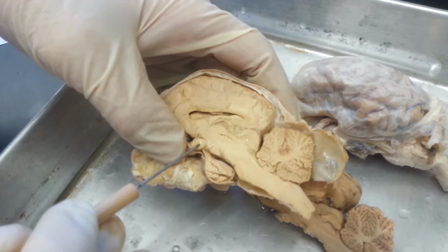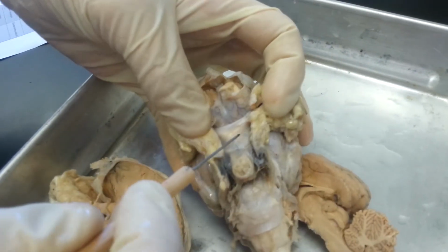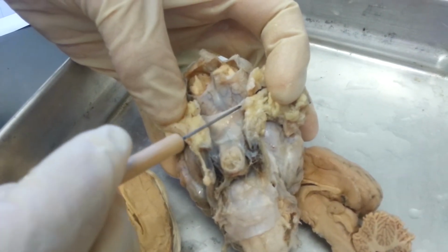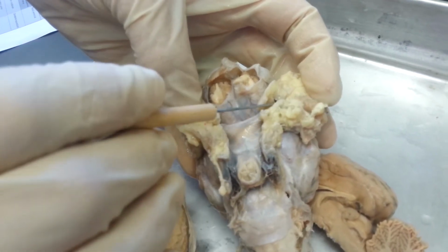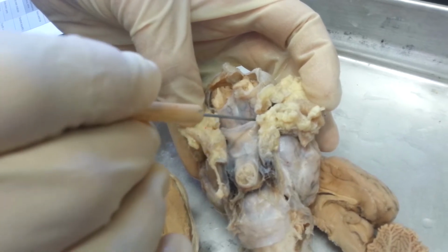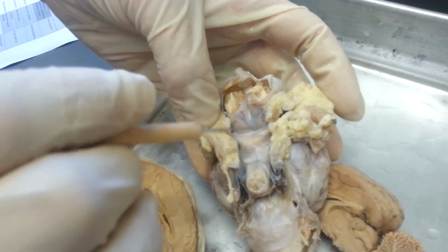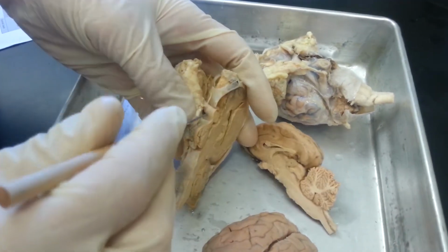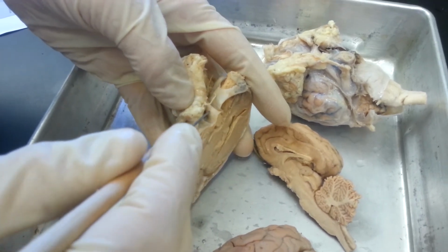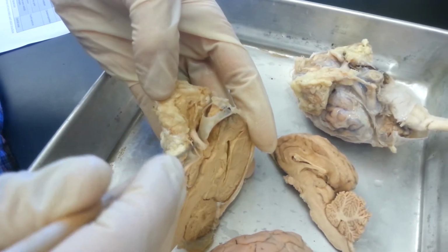And then the optic nerve forms an X. I'll show you on here. You can vaguely see it there. They still have the meninges on it. But the one going to the left eye comes from the right hemisphere, so they cross each other. Chiasm means X, so the optic chiasma is those two nerves as they cross each other. So this is one optic nerve, and this is the optic tract going to the eye. This still has an eye attached to it.